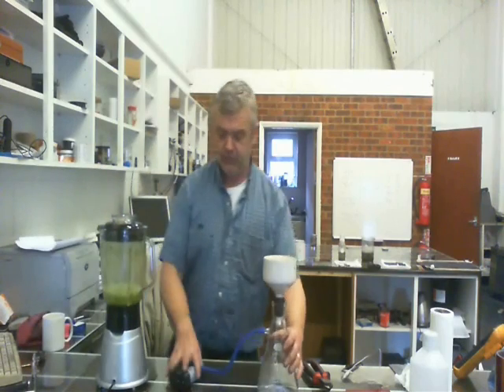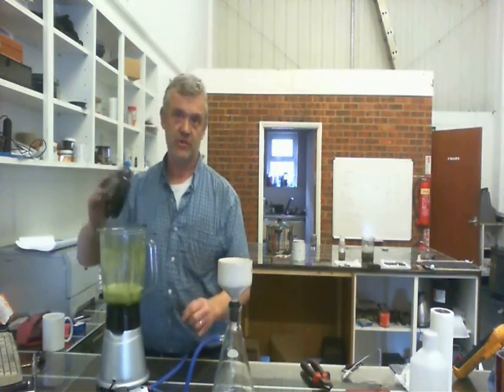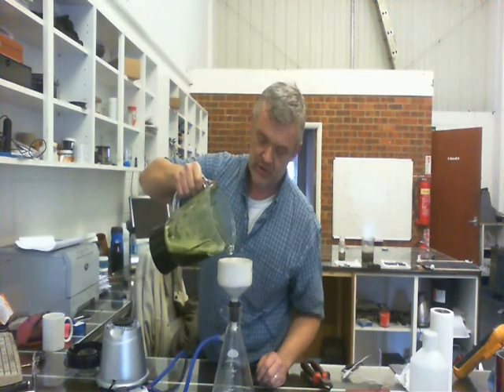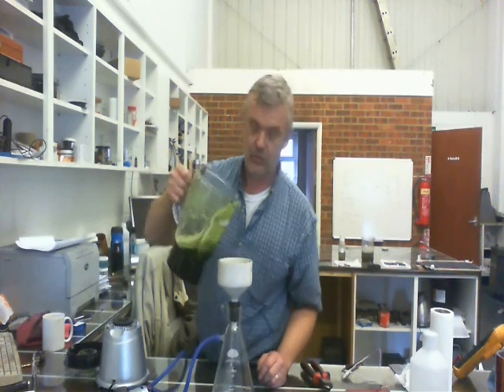At the end of 20 minutes, turn it off and filter it. I've got a vacuum filtration set up here because it makes it much quicker. If you don't have one, you could just filter it by itself. You just need to wet the filter paper first so it forms a seal.